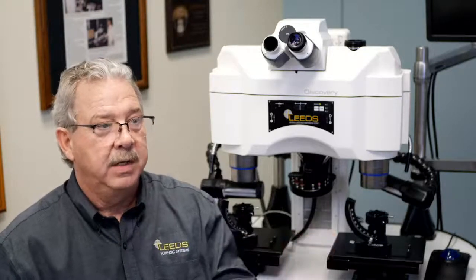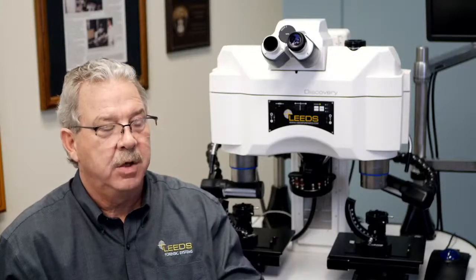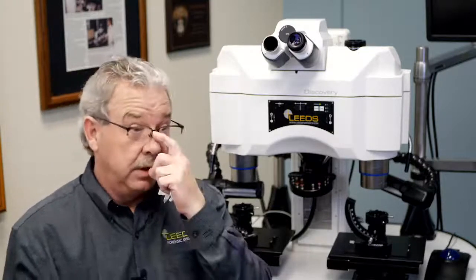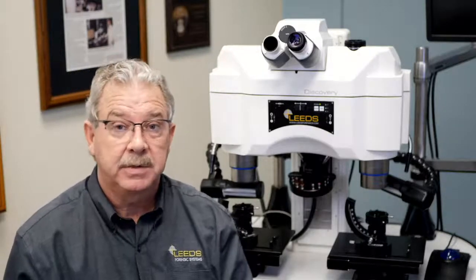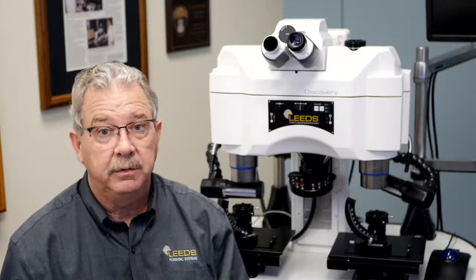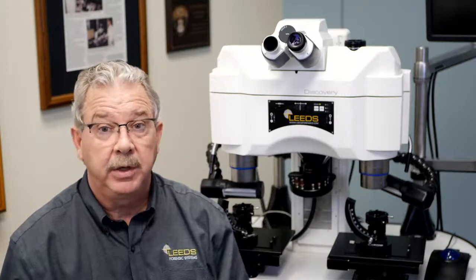I've almost implied that this is endless. You see 18mm field of view is the smallest. 22, 23mm is getting to be on the larger side. There is a theoretical limit. I don't know the science behind it, but I've always heard that a 25mm field of view is the max that the average human brain can take in.